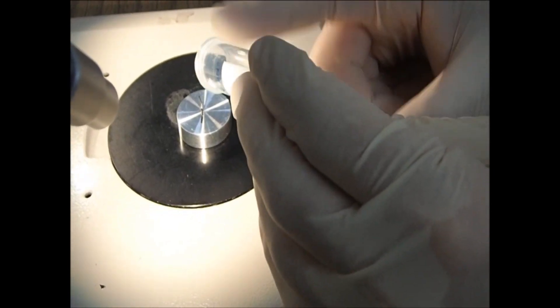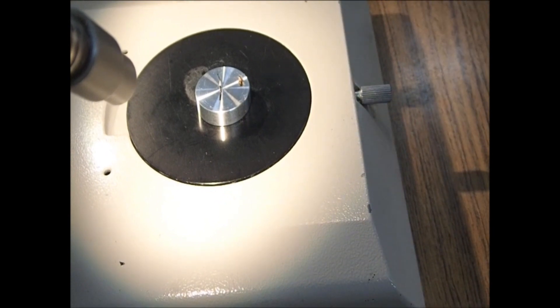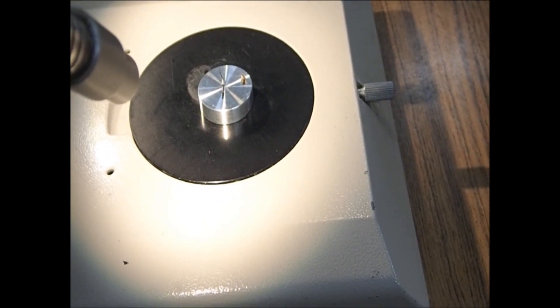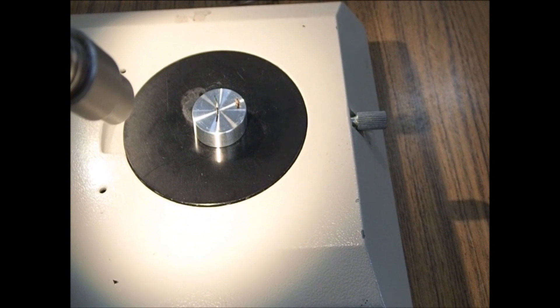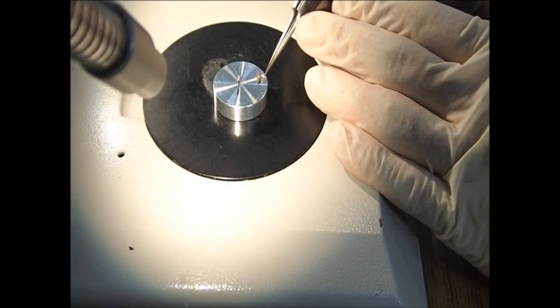Live samples should be transferred to the sample stage with as little damage as possible. Place the sample near the center of the sample stage.